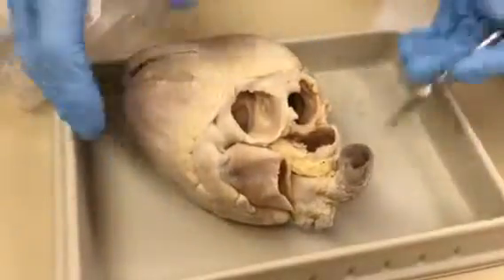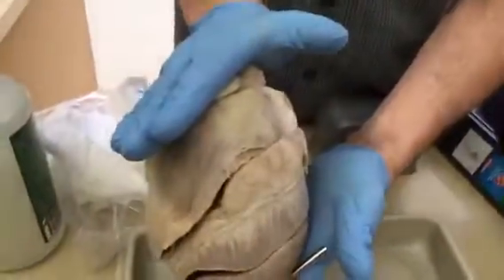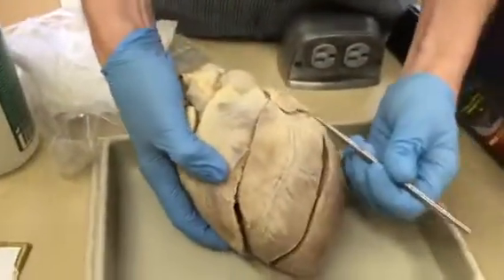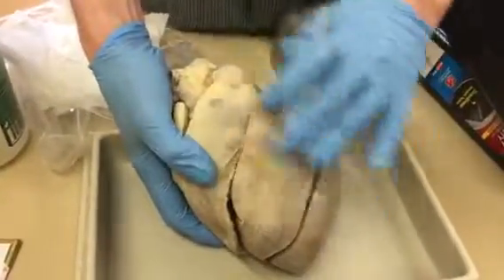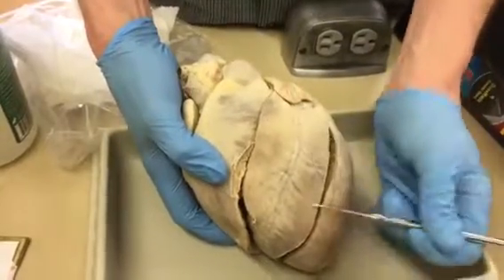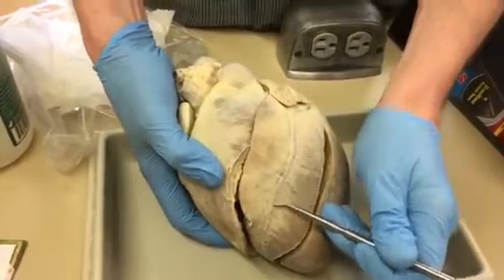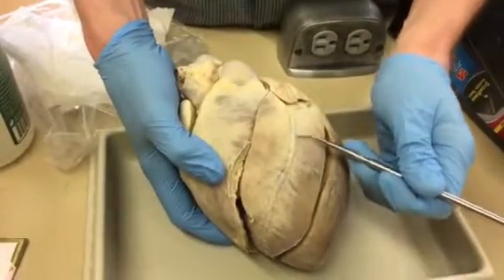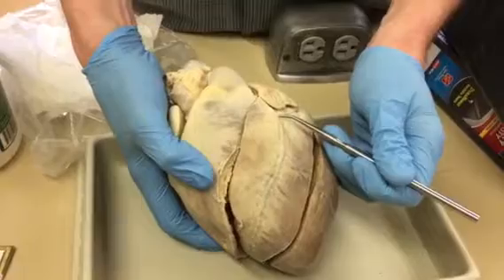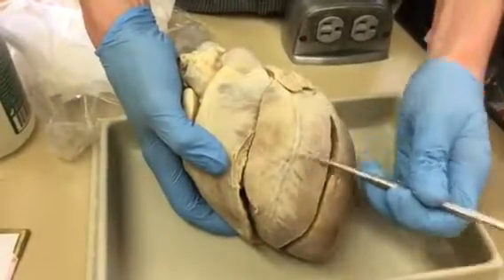Then when we get to the heart areas, there's the apex, obviously, and the base is this flat upper part. We're on the anterior side because we have no openings here. So we're looking at the anterior interventricular sulcus, and in that sulcus is the anterior interventricular artery. That's the only one. There's a vein in there too, but I'm not asking, it's not on here, so you only have to ask about the artery.